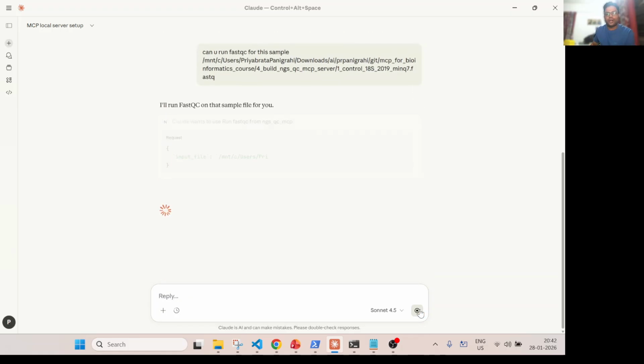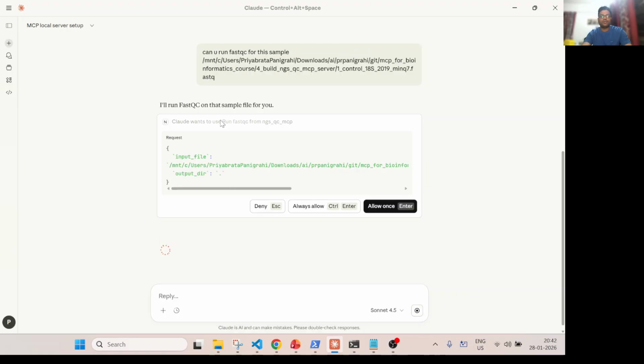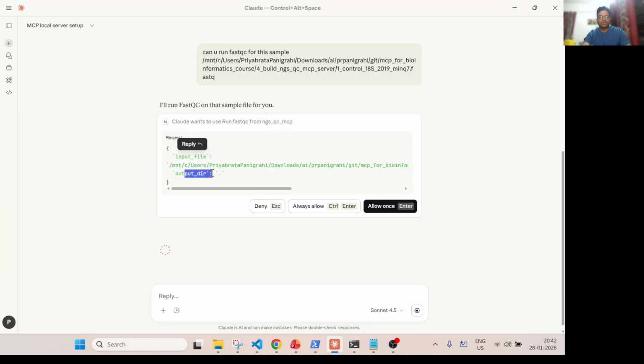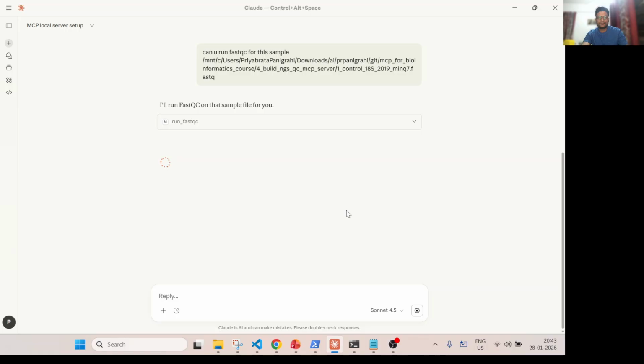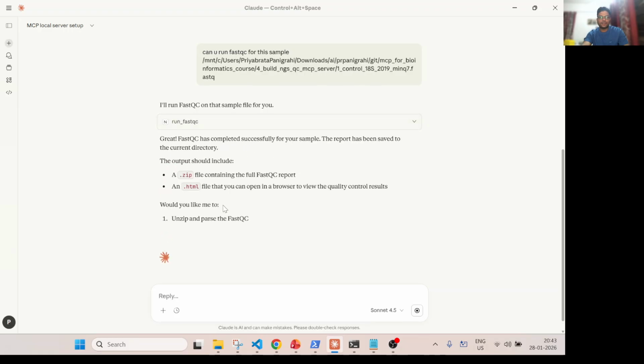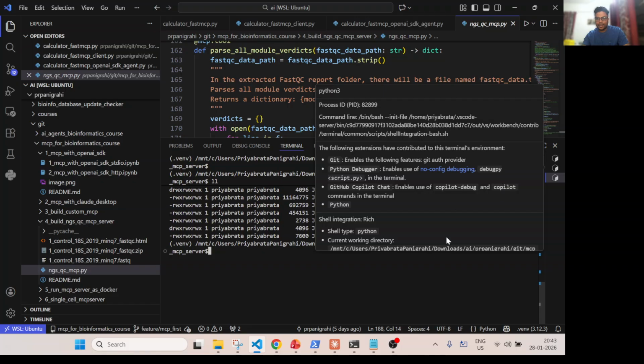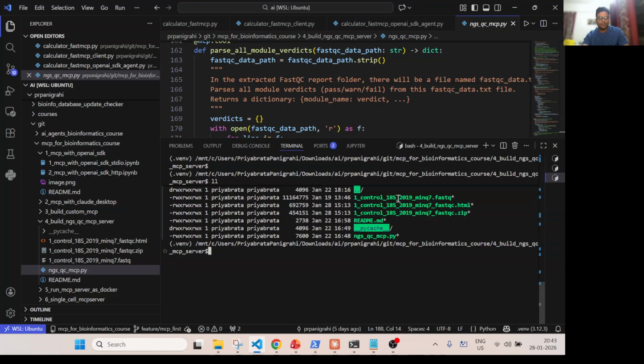So now it will go and call, hey, I want to run FastQC from this MCP server. See, automatically it created this JSON input structure, right? Input file and output directory equal to dot. I don't know where it will run. Okay. So FastQC has completed successfully. So let's check where it ran. Yeah, it ran in the same folder here, right? So now you see we got a zip file and an HTML report also.